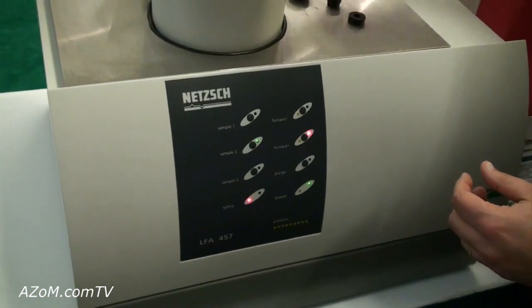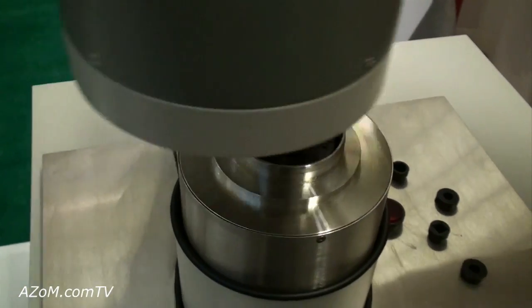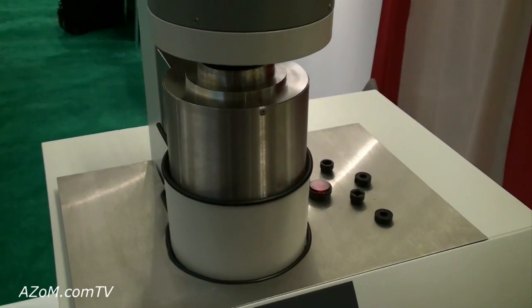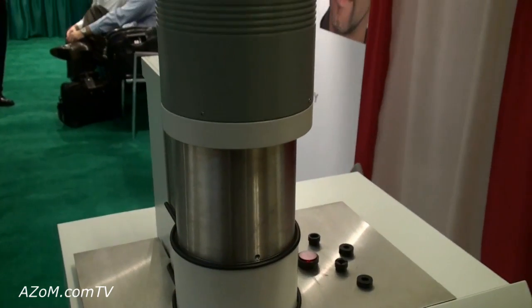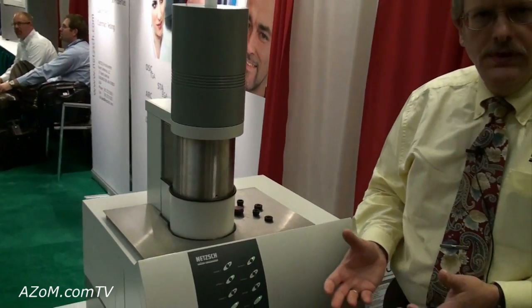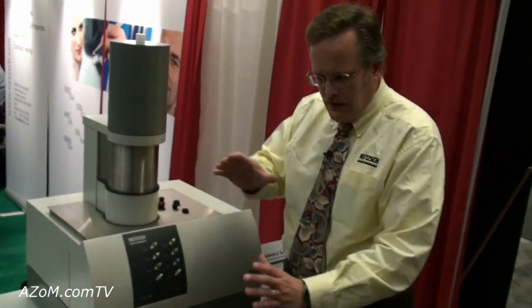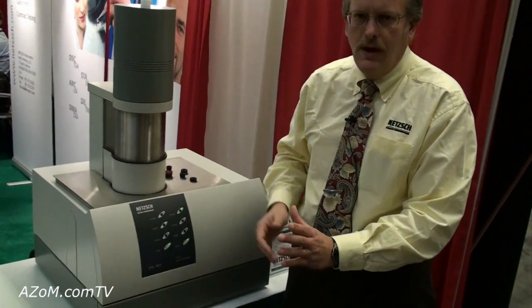As we put the samples in and close the furnace, what you'll see on top is the actual infrared detector. So the laser pulses the sample and heats the sample only a couple of degrees. We don't want to heat it with too much energy, just a small amount. The infrared detector on the top looks at the heat signature, the heat pulse.